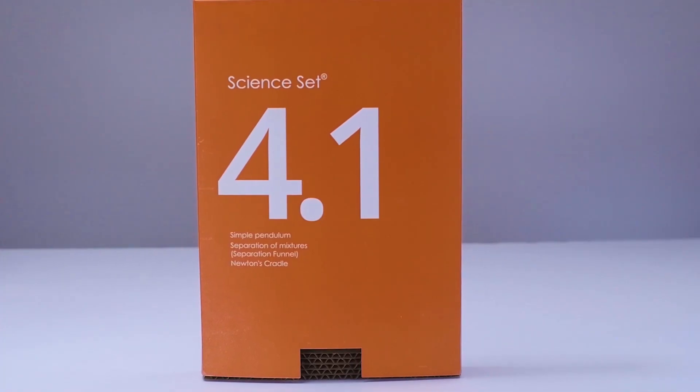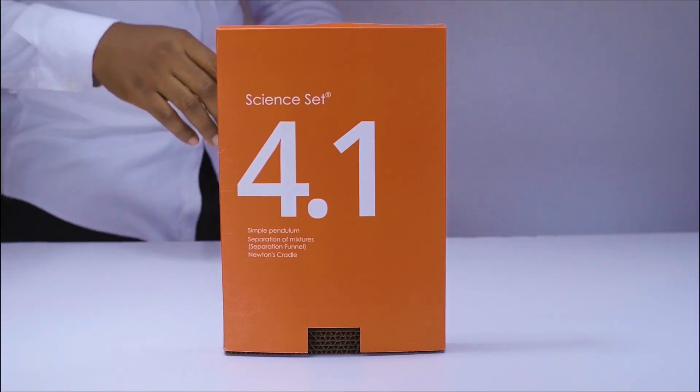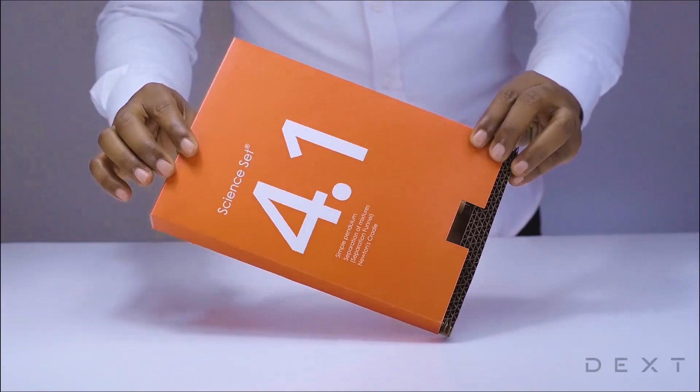This is a tutorial for Dext Science Set 4.1. Hi, in this video, we will investigate how to separate a mixture of immiscible liquids.